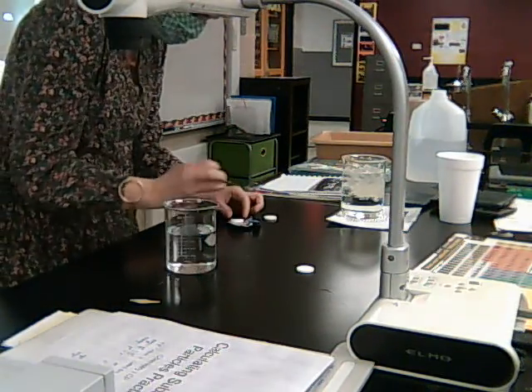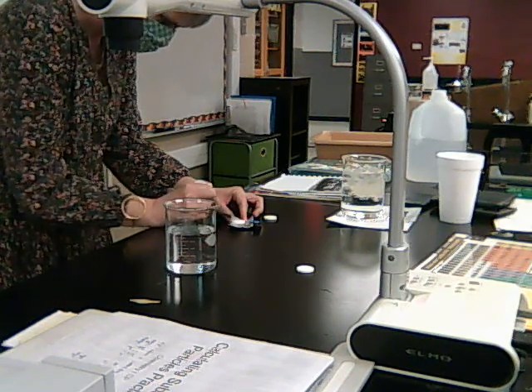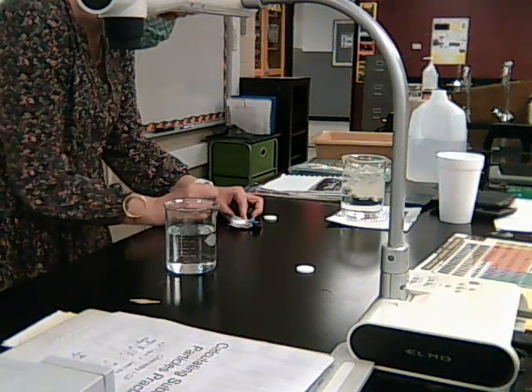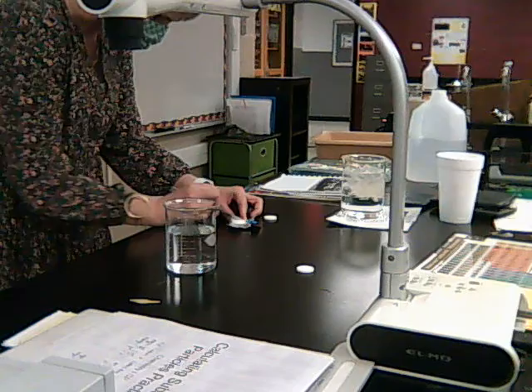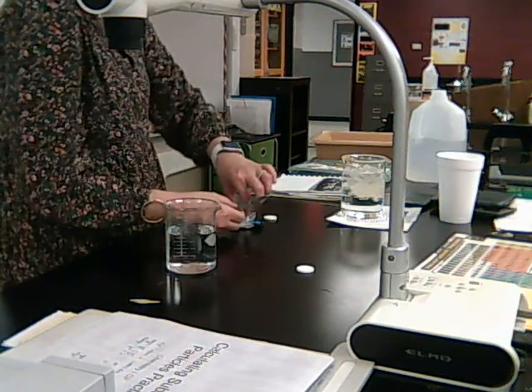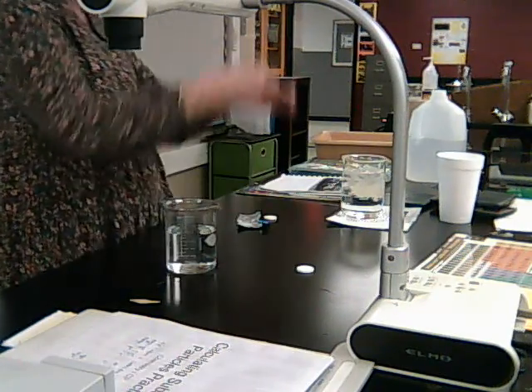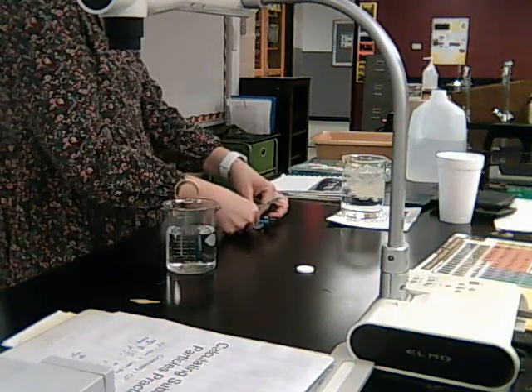So I'm going to scratch this. This might not be exactly half, but it's going to be close. I probably could have done a better job of getting right in the middle, but anyway, it's going to be about half. Now notice another thing that I'm doing. Okay, so there it is. It's not exactly halves, but it's close.